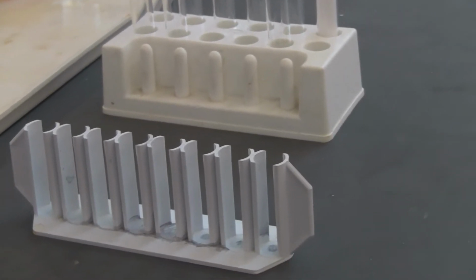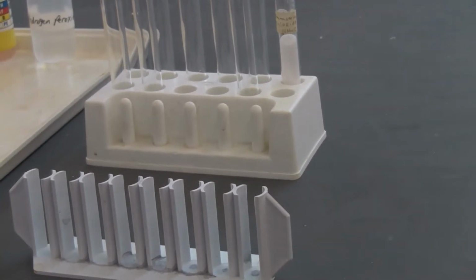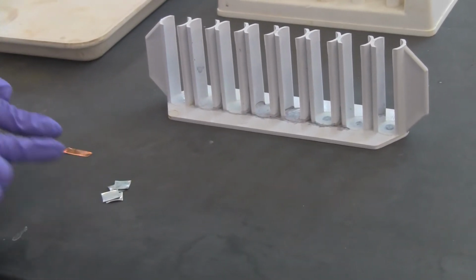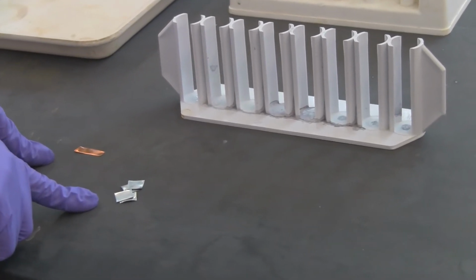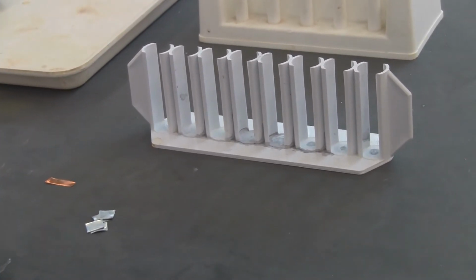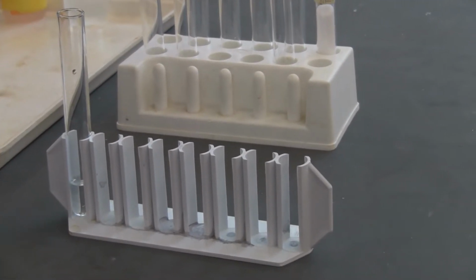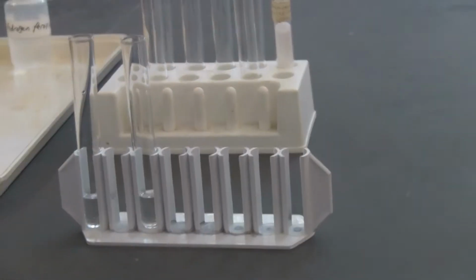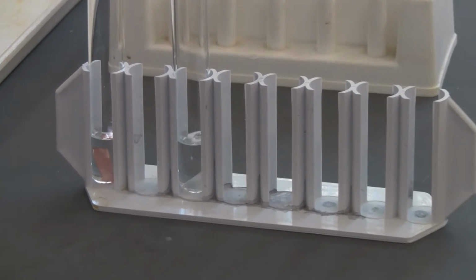If you look at the procedure, we're going to have the same acid, but we're going to use different metals. This is the zinc metal, this is the copper metal. You're going to say, react with the same acid, 6 molar hydrochloric acid, which one is going to have a faster reaction. This is the 6 molar hydrochloric acid, and another one also 6 molar. In one I'm going to put the copper, and in the other I'm going to put one piece of zinc.